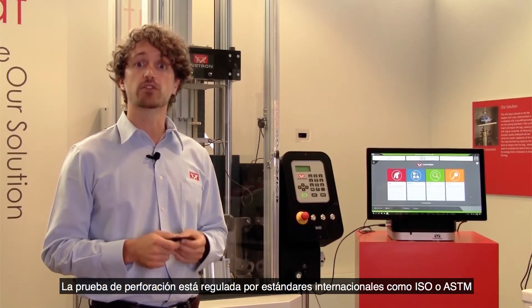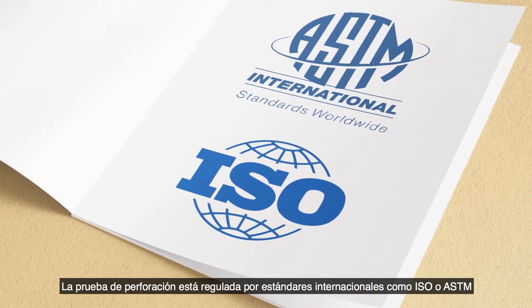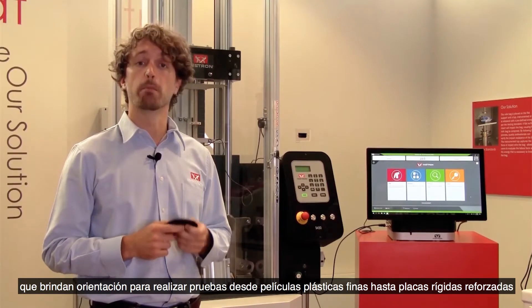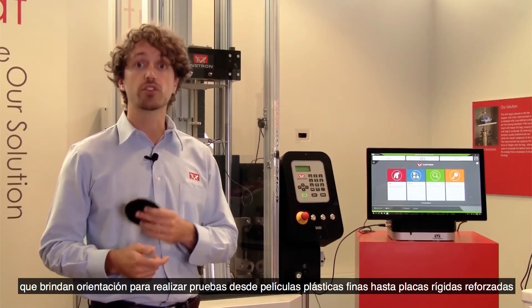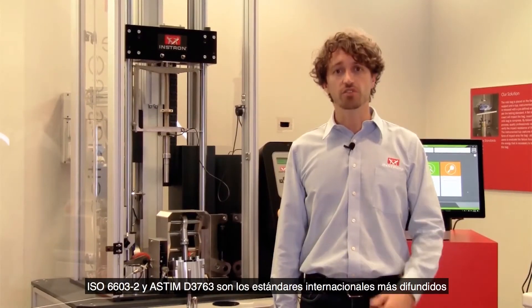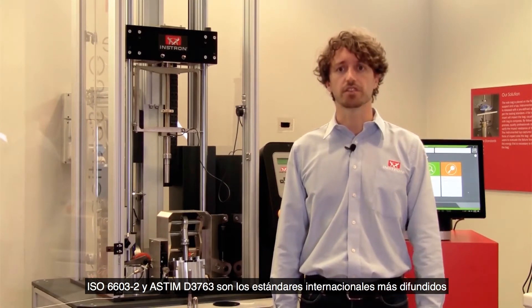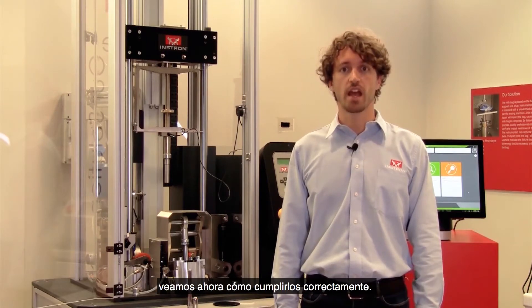The puncture test is regulated by international standards like ISO or ASTM. They provide guidance to test from plastic thin film to rigid reinforced plates. ISO 6603-2 and ASTM D3763 are the most diffused international standards. Let us see now how to properly meet them.